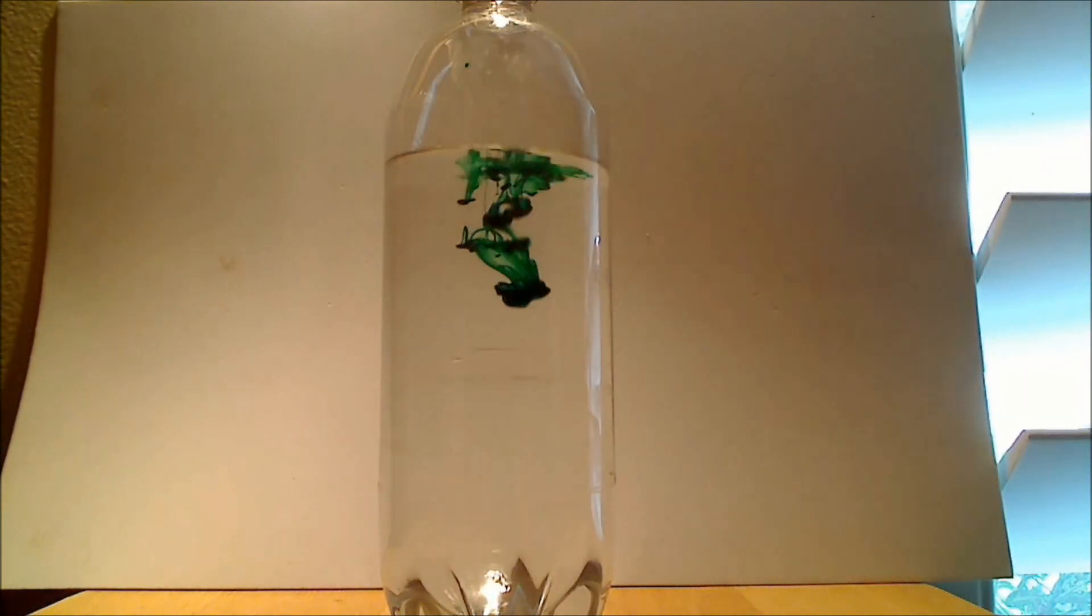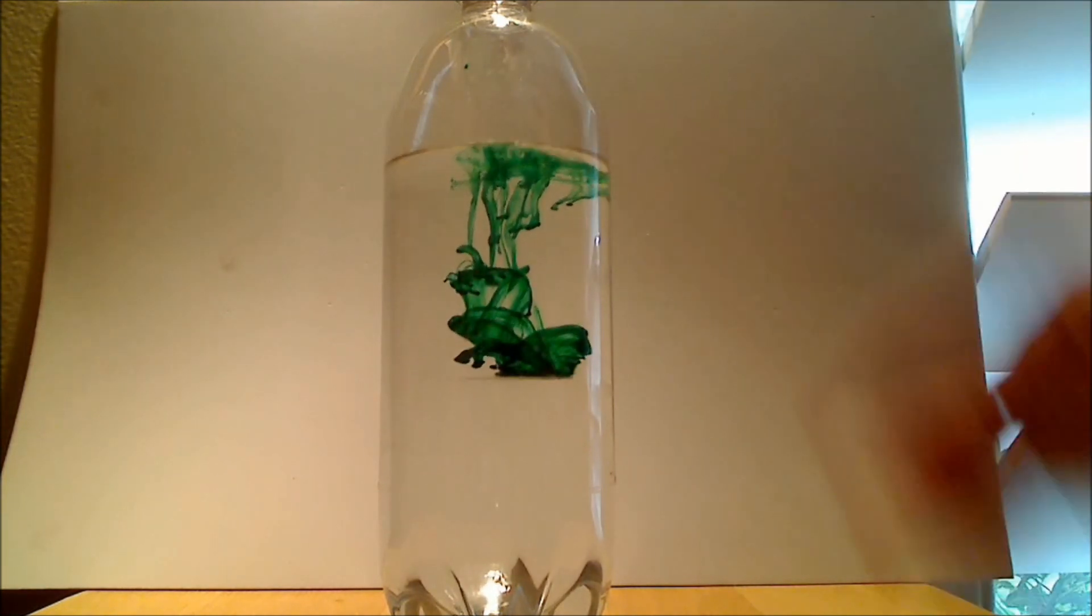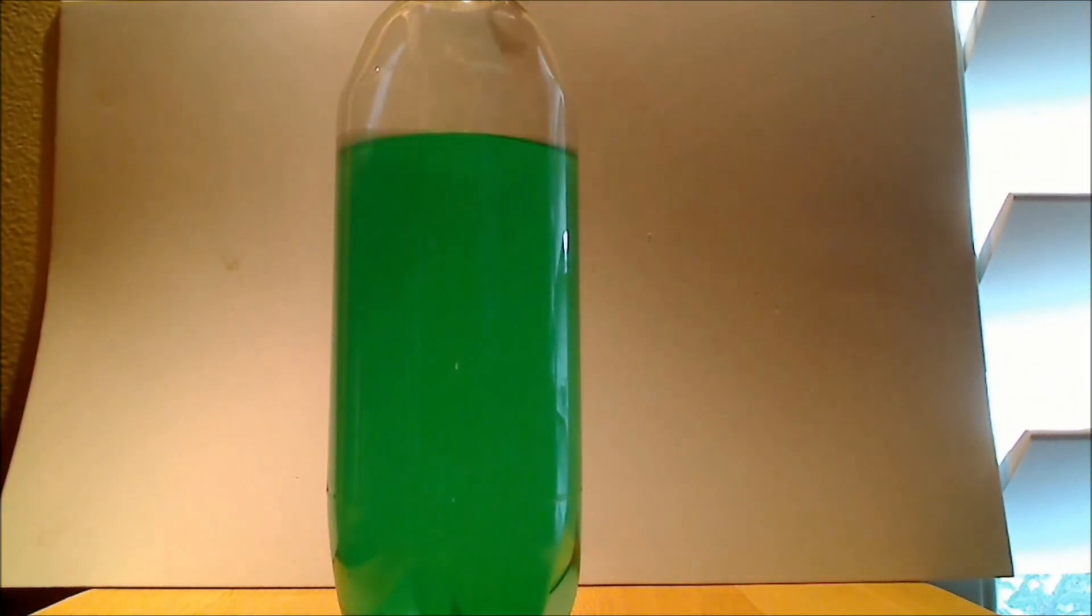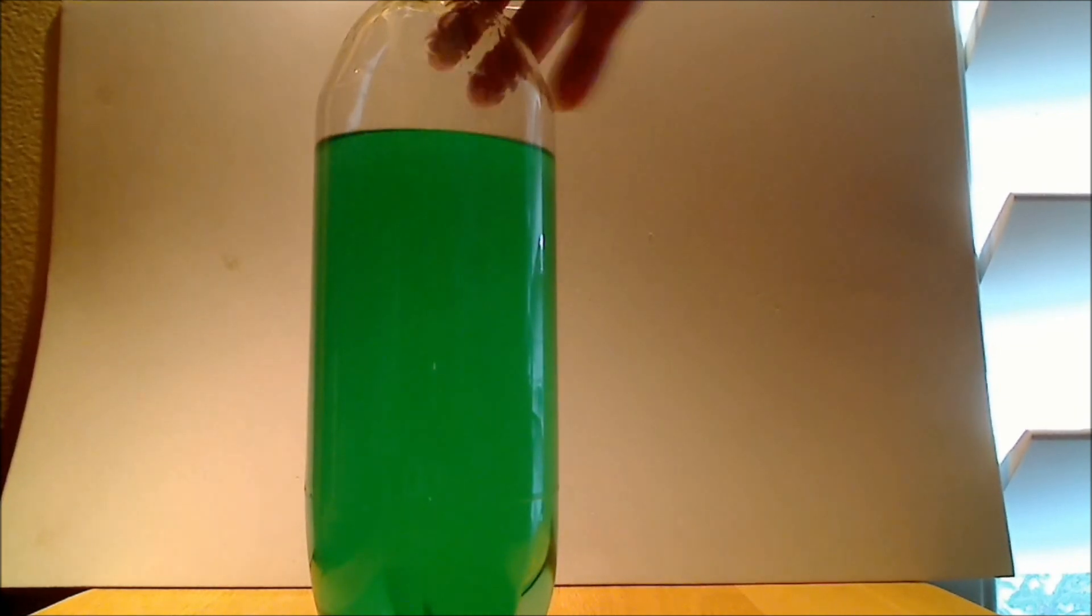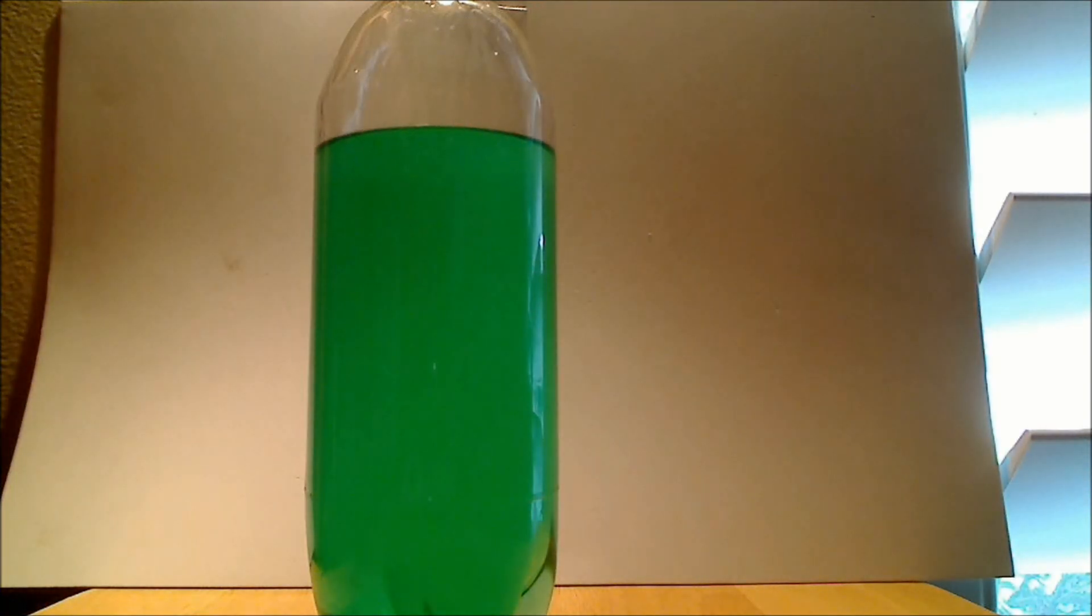Two drops. And now I'm going to cap it and shake it up again. You can see I have one phase there. But it's a very turbid mixture. It's really an emulsion. And let's see what happens with time as the two phases separate.